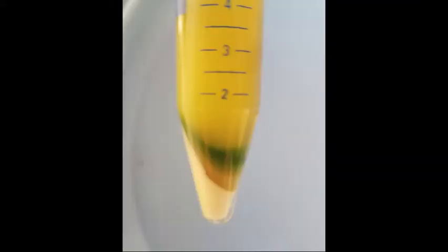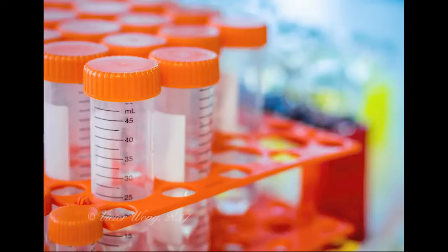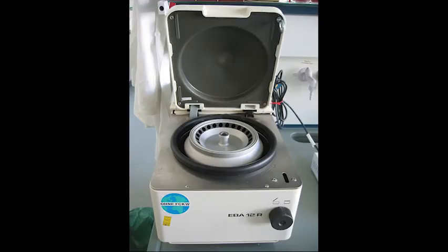Remove only one of your tubes from the centrifuge and use it for further examination. You will need the remaining tube for centrifugation at a higher gravitation force. Note, you must replace the tube that you remove with another centrifuge tube that contains exactly 14 milliliters of water. This must be done to keep the centrifuge balanced. A second centrifugation will be done for 10 minutes at a gravitation force of 1300 G. Centrifugation at the higher gravitation force will allow sedimentation of chloroplasts and nuclei from the filtrate.